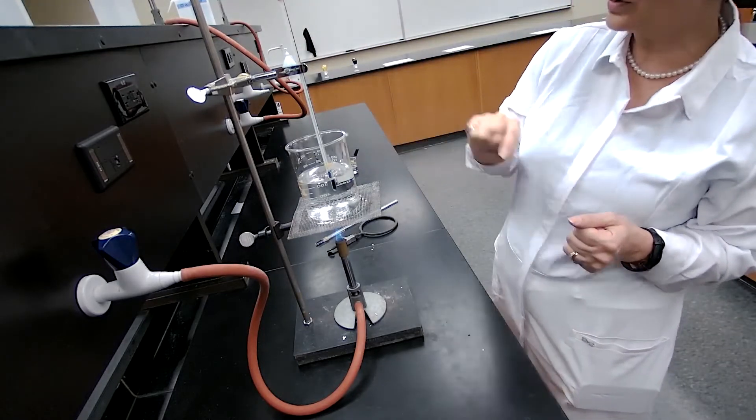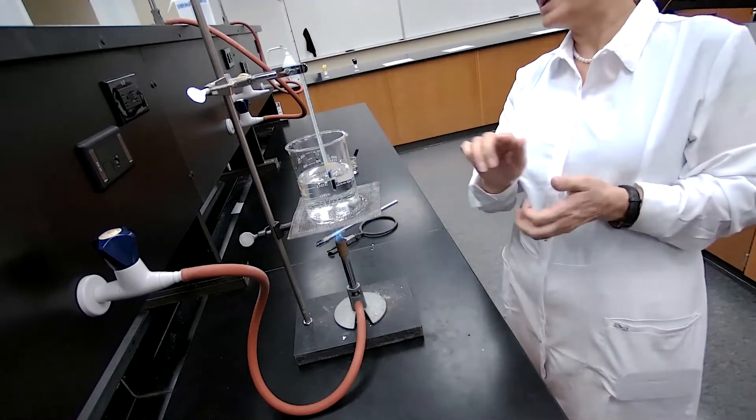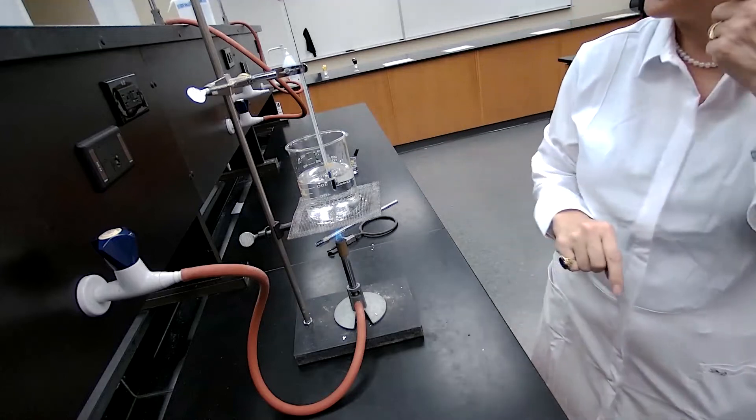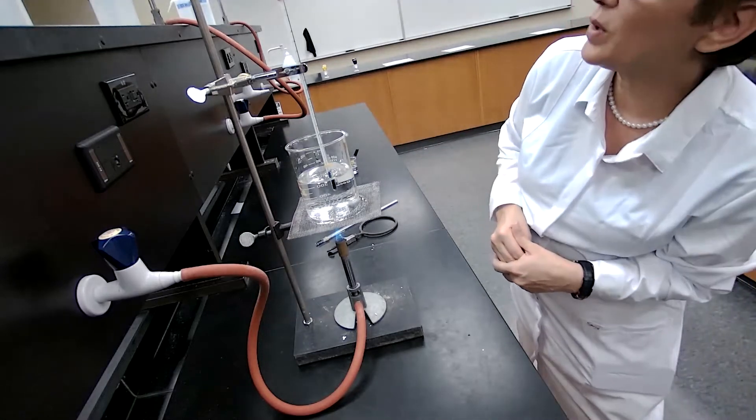So I wait for those bubbles. And as soon as I see the bubbles, I will bring the camera closer for you to see it as well.